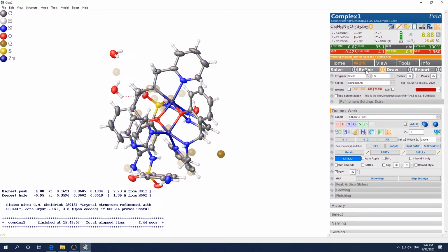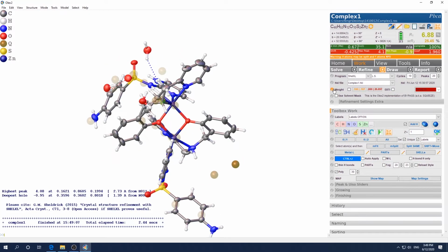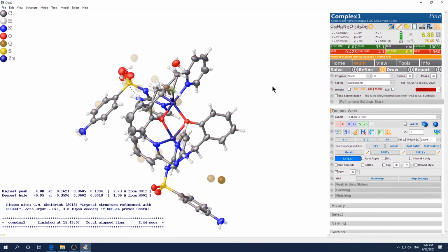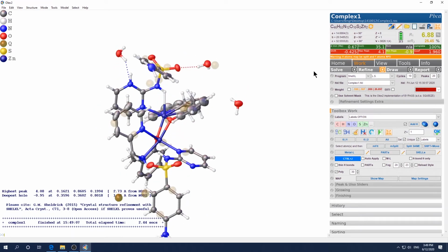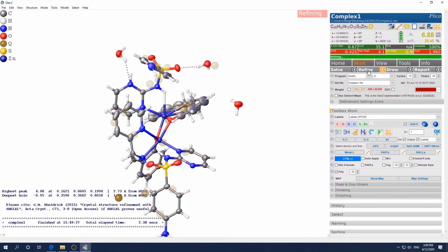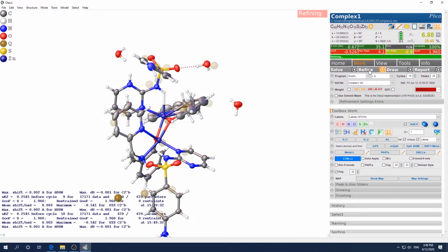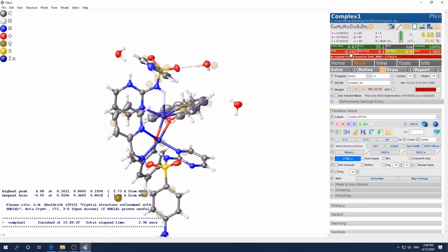It drops the R1 and shifts. What's the shift? Let's see. Yeah, its shift is a different one, so it doesn't matter. And we want to repeat several times to see if anything will change. Okay, something is not correct. It's getting worse.